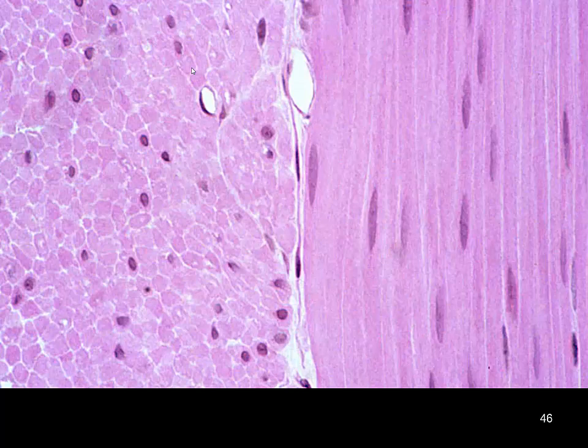Much like we talked about in lecture, here we have a great view of cross-section of smooth muscle versus longitudinal section of smooth muscle. Easy to pick up those centrally located nuclei, our endomysium or external lamina. It's the same terminology, means the same thing around these cells, versus our elongated oval-shaped centrally located nuclei in this streaming smooth muscle.